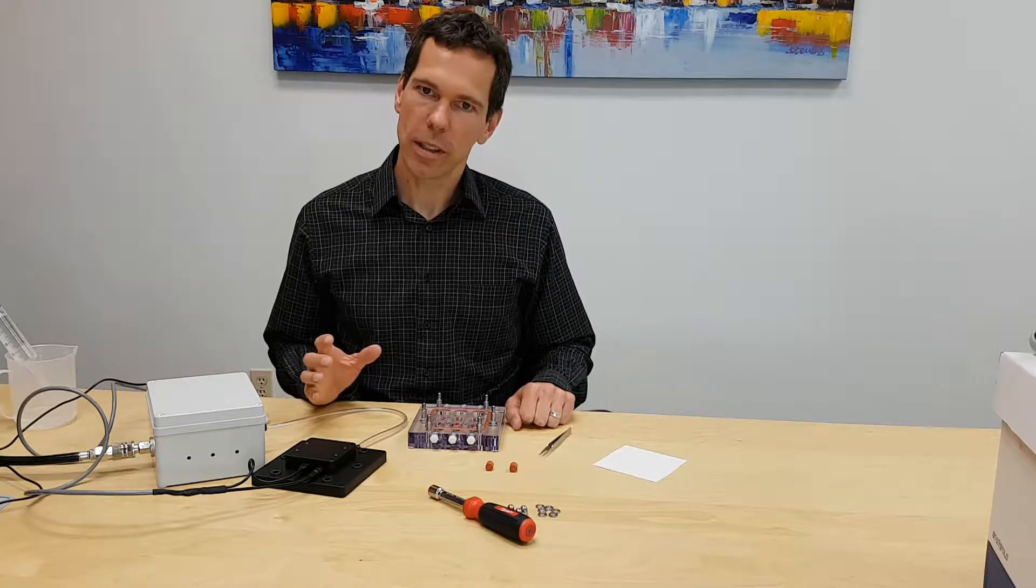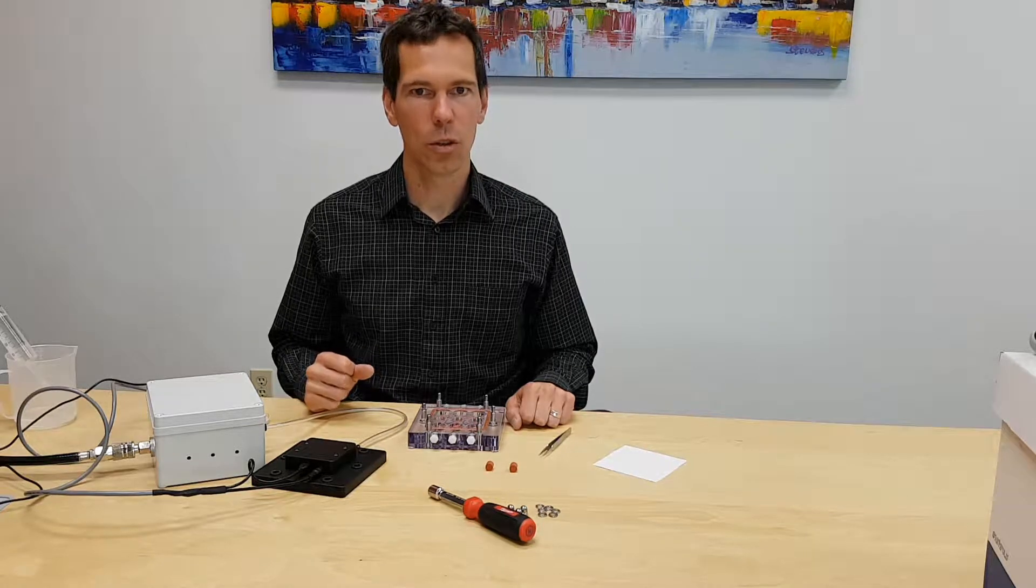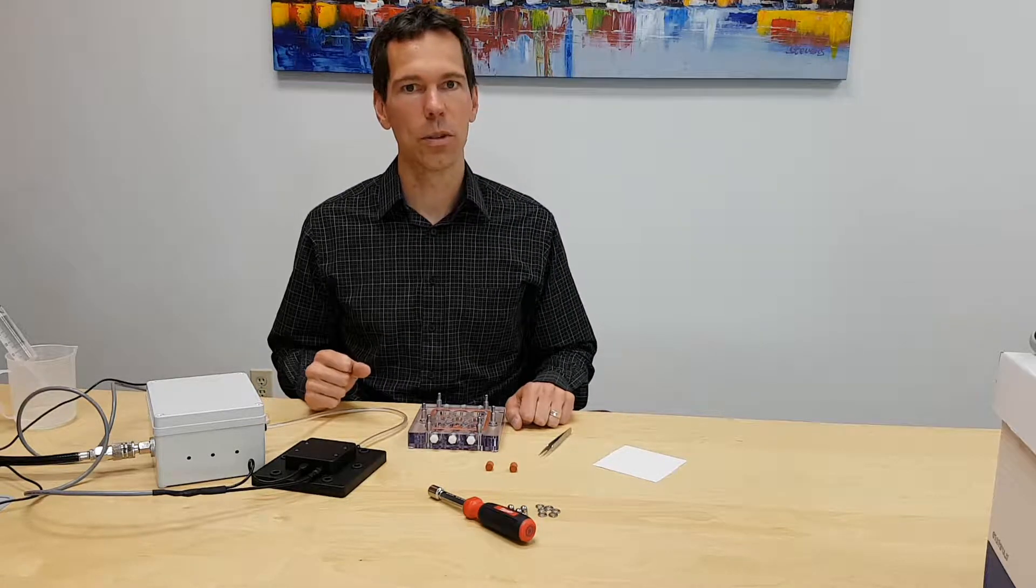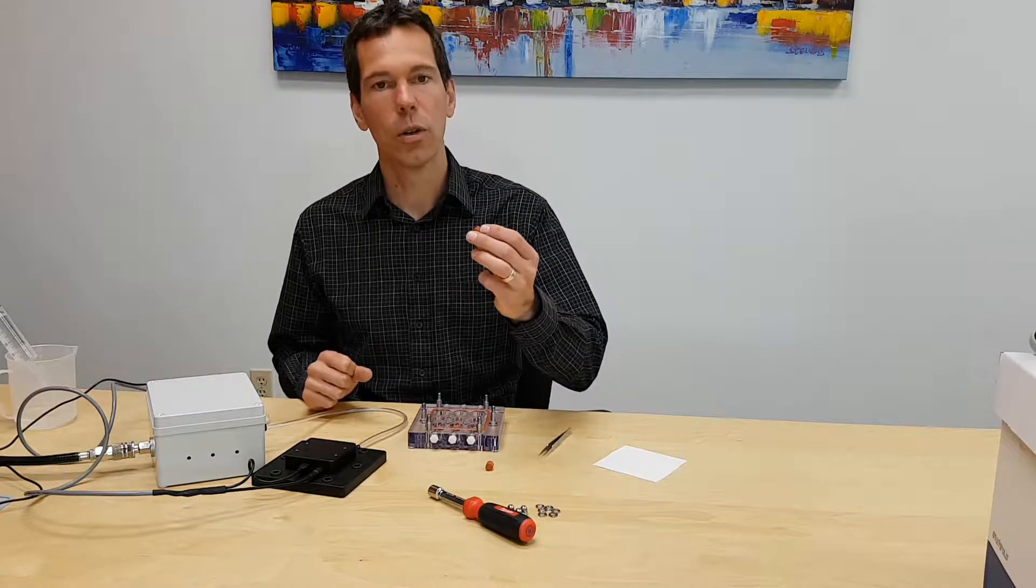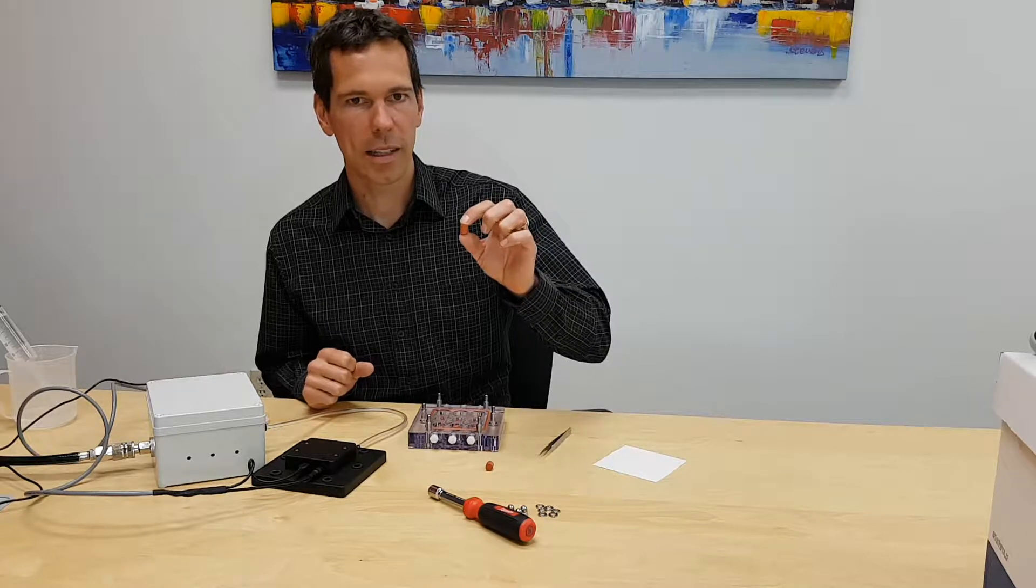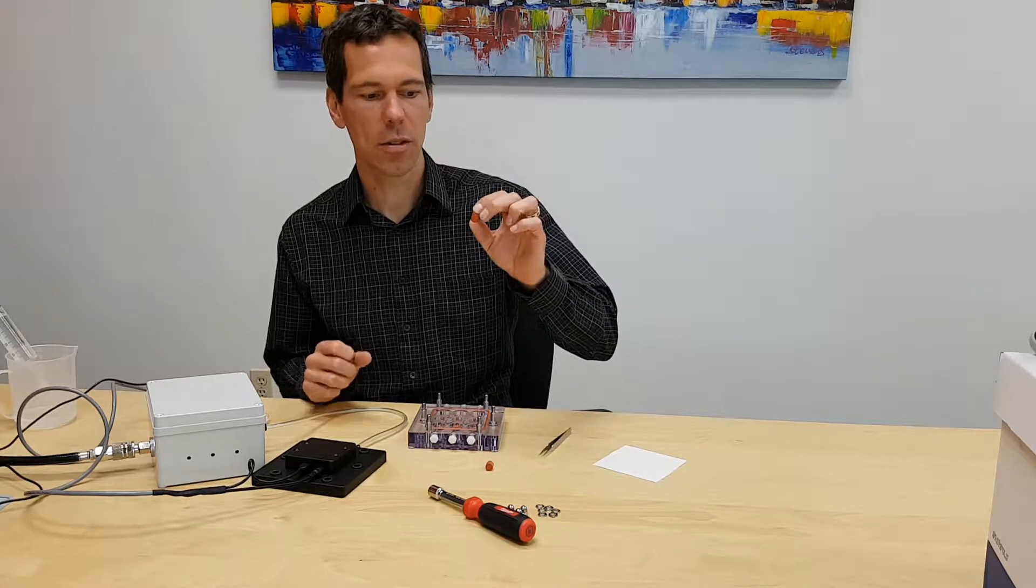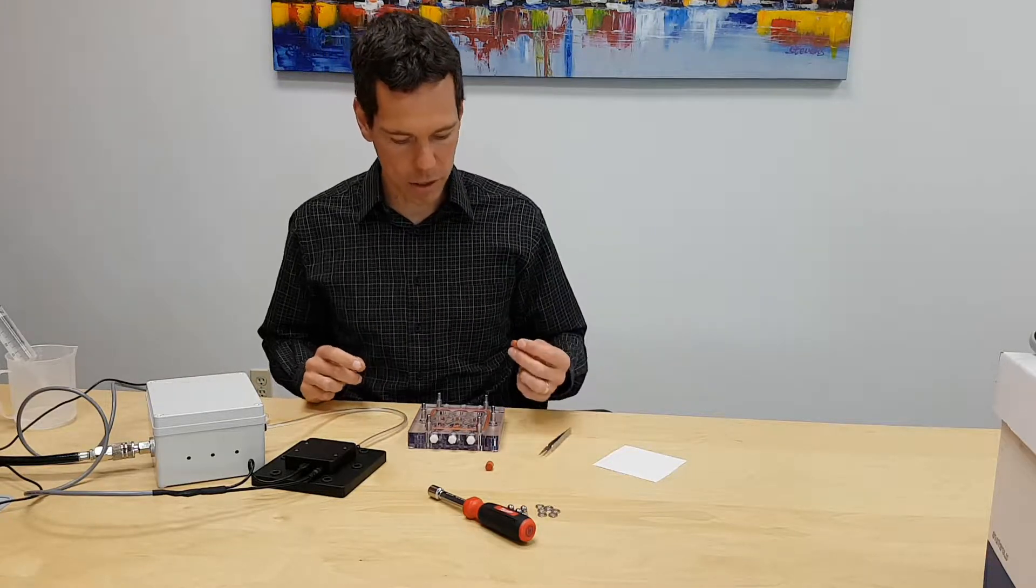Today I'm actually going to be using the system to provide hydrostatic stimulation to three-dimensional tissues. Instead of tissues, I'm going to be using these small closed cell foam samples. The nice thing about the closed cell foam is when I provide the hydrostatic pressure, we're going to actually see the foam compress in on itself. I'm going to apply 300 kilopascals of pressure.